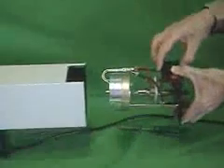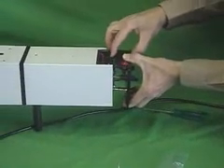Then you put it in straight into the back of the lamp housing. And it will just sit there. Then you can put the Phillips screws back in.